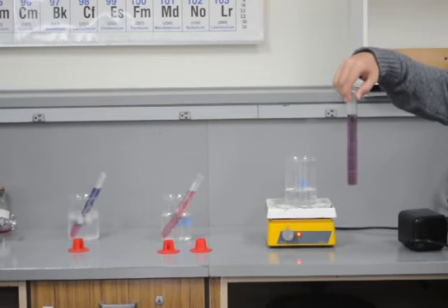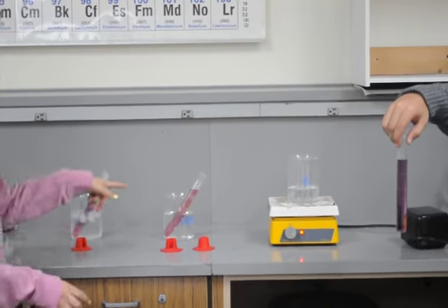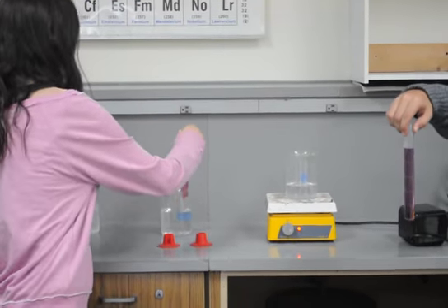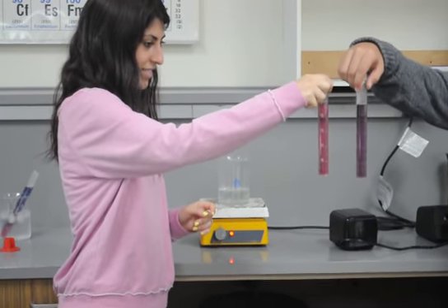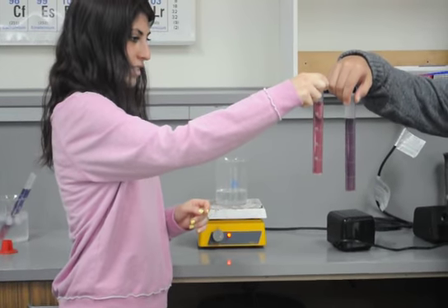And Shake, would you hold up the room temperature next to that? There we go. See that? Cool, huh? Alright, we're going to let this cook a little longer.